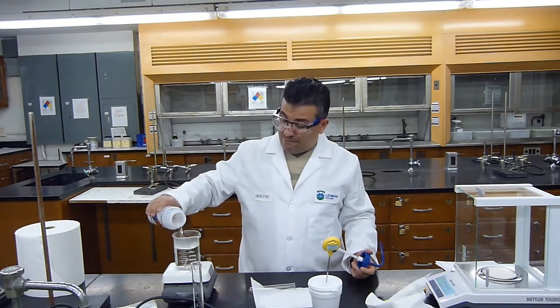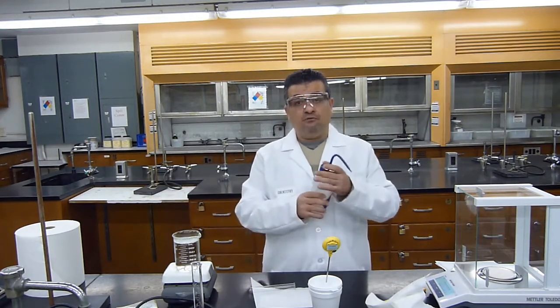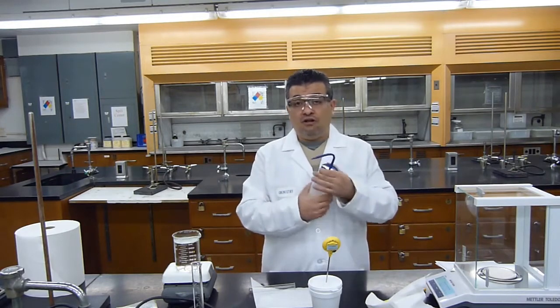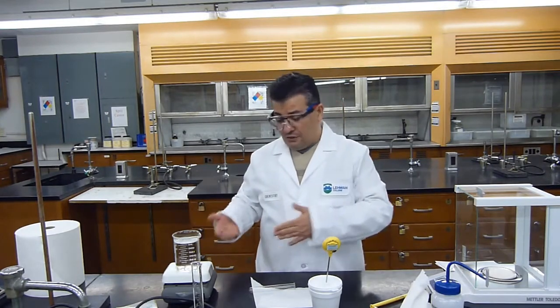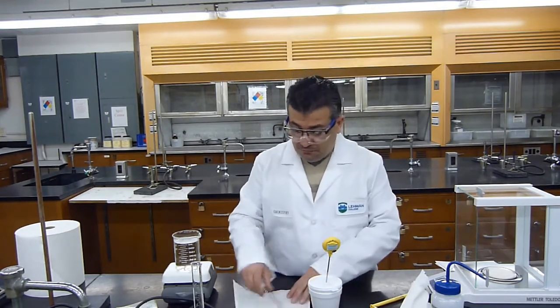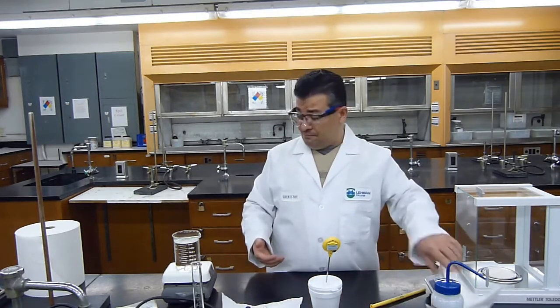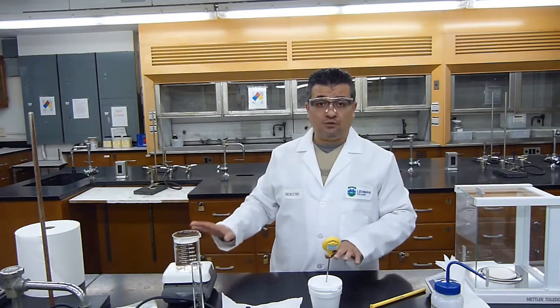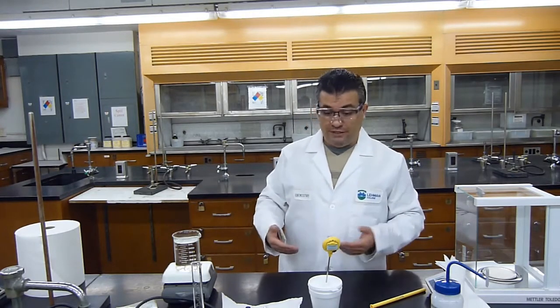This way when I put the test tube inside, I will make sure that all of the metal is covered with water. Of course I have to wait again for the water to be brought to boiling, but that should not take as long as the first time. So always keep the heat on. This way you don't waste time.